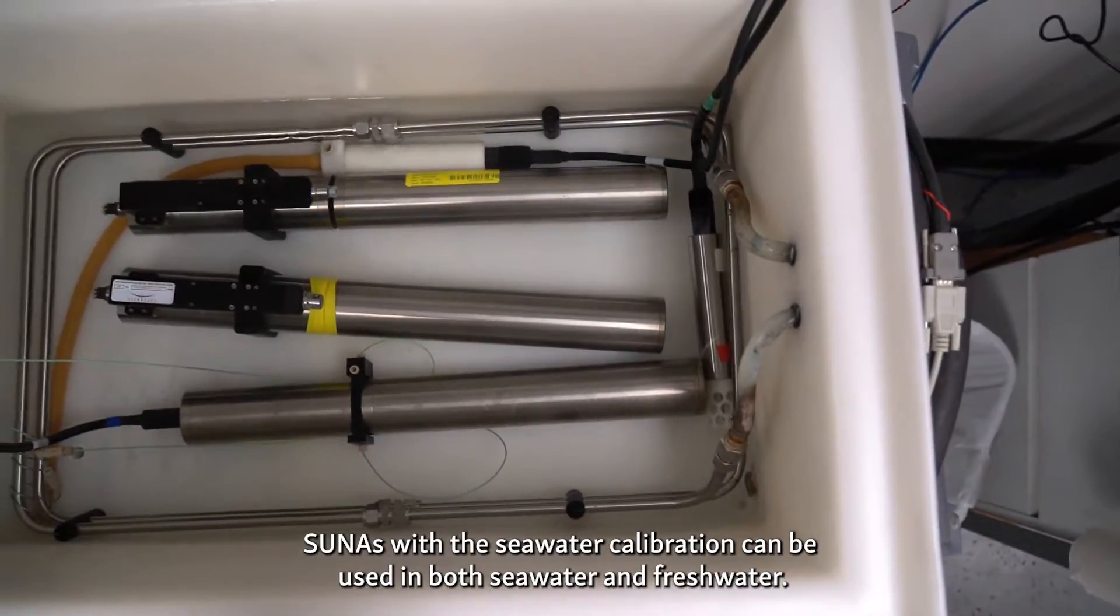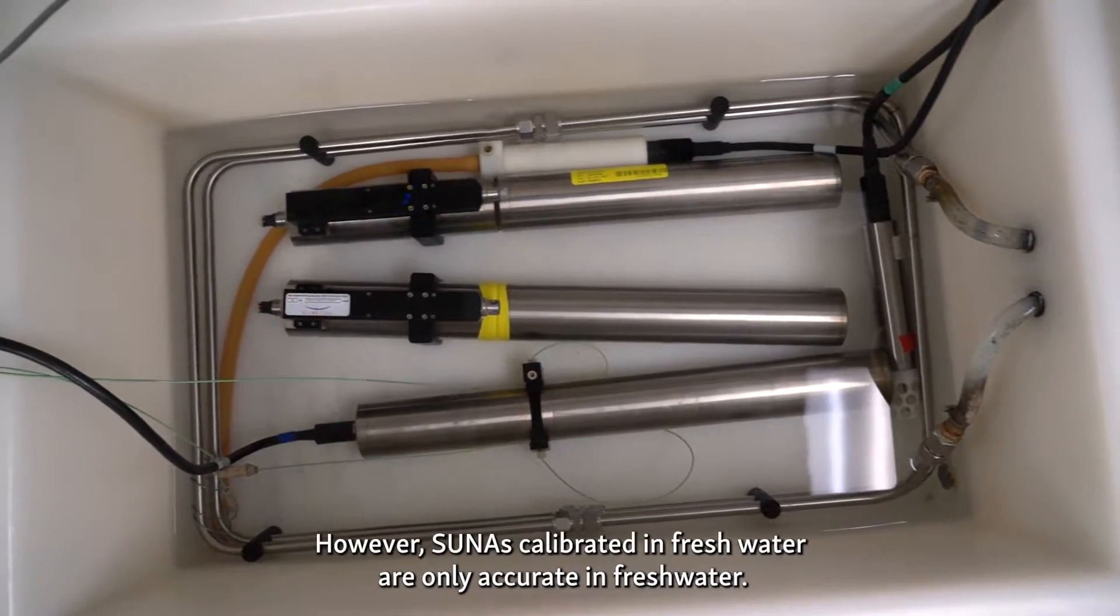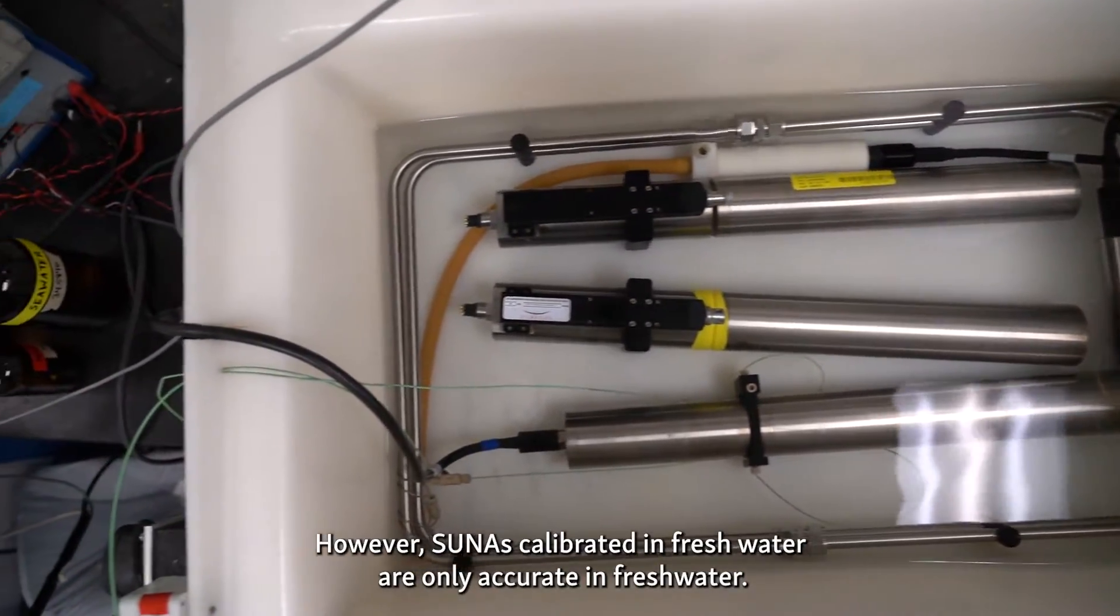SUNAs with the seawater calibration can be used in both seawater and freshwater. However, SUNAs calibrated in freshwater are only accurate in freshwater.